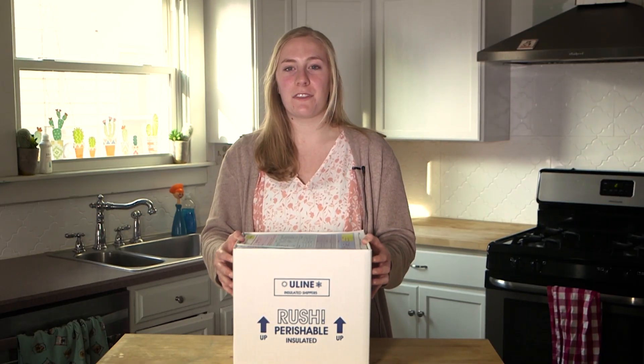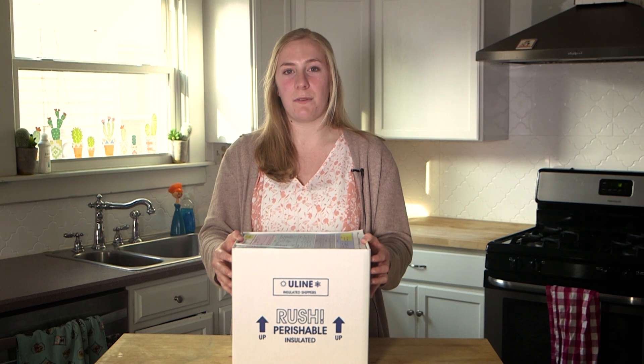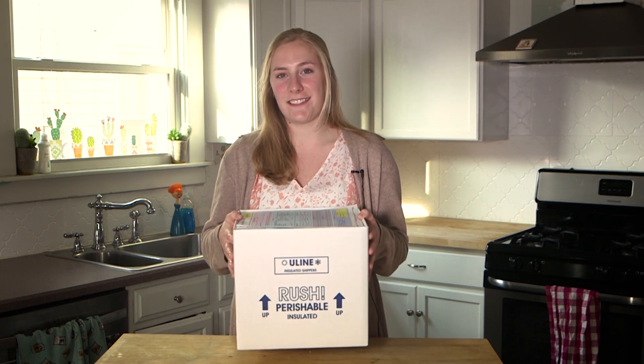Hi, I'm Becky and I work in the State Drinking Water Laboratory. Today we're going to talk about drinking water sampling for PFAS. Sampling for PFAS is very important and it is critical that the sampling is done properly to ensure accurate results. In this video we will show you everything you need to do to ensure that your drinking water is tested. Grab your kit and let's get started.